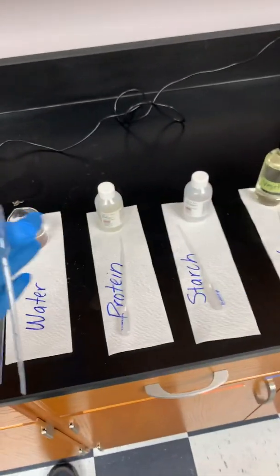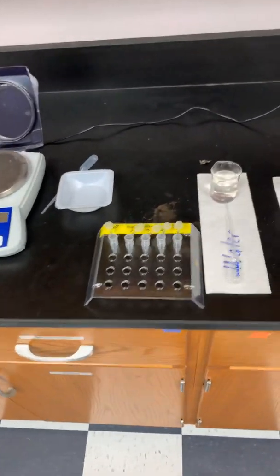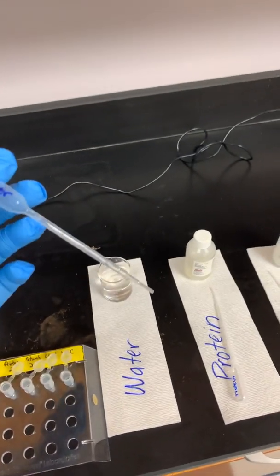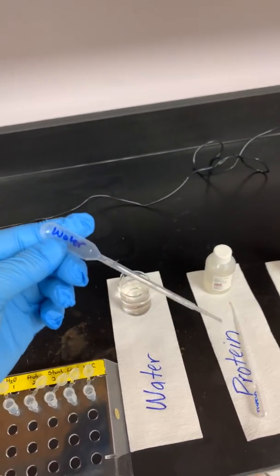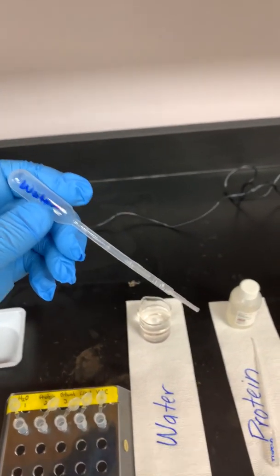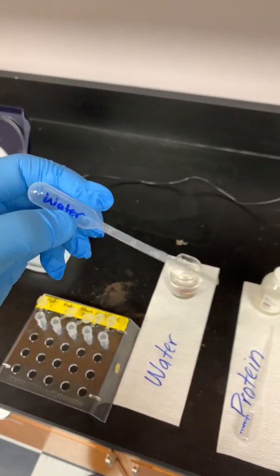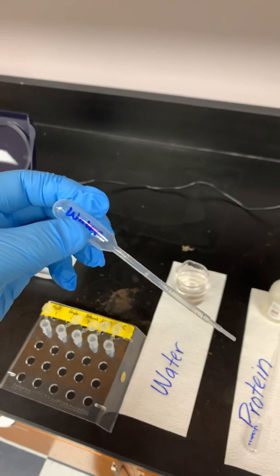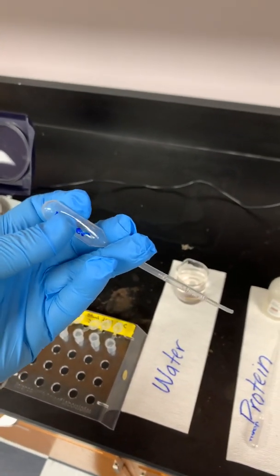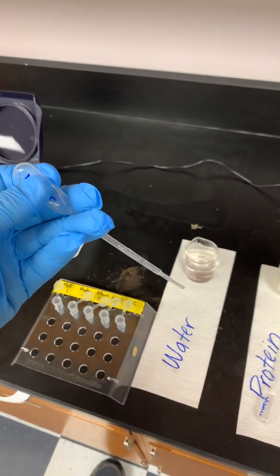We don't want to get these mixed up, because if you even get just a drop of the wrong thing in there, it's going to mess up your results. So we want to use the transfer pipette that says water to get our water. So anytime you use any type of pipette, the first thing you want to do is make sure you have a good solid grip on it. Make sure that it's seated or situated properly. In this case, we're going to hold it firm like this. What I like to do is wrap 2 fingers around it like that, and then I'll use these 2 fingers here, my thumb and my index finger, to actually control that pipette.